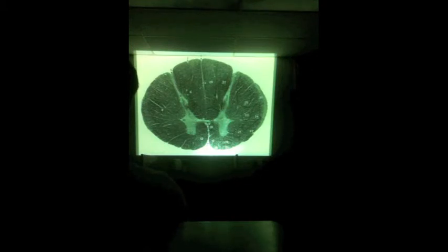Yeah, it has myelination, which usually gives it a whitish look, depending on what type of stain you're using. In this case, obviously, it doesn't look particularly white, but this is the white matter, and it's named that because of the myelination. And in the gray matter, you could potentially still have myelination, but what is the big feature of gray matter that helps distinguish it from white matter?